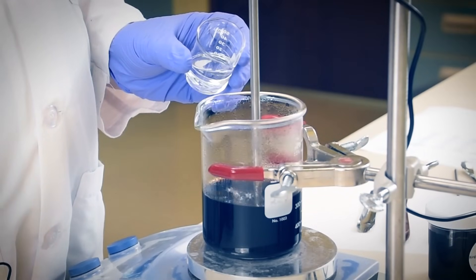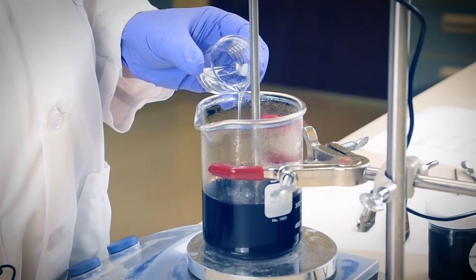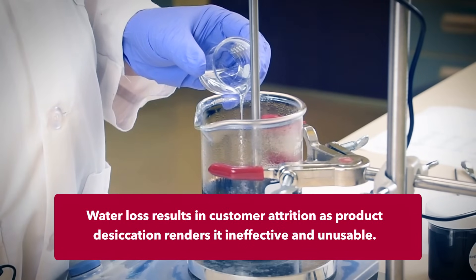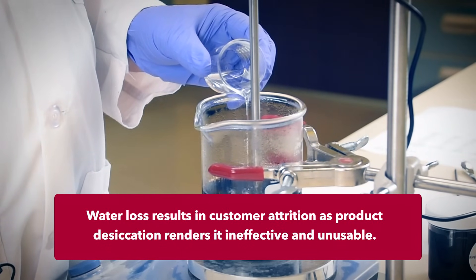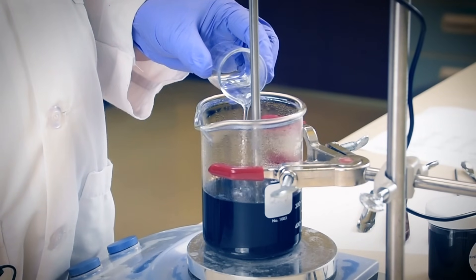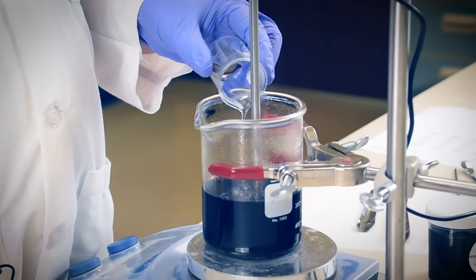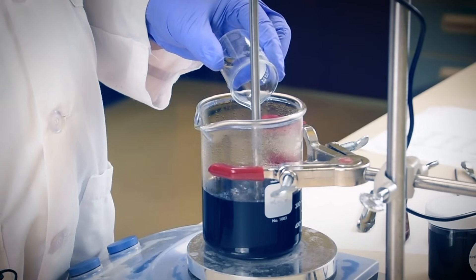We'll then add two polyols in equal amounts: glycerin and butylene glycol. These perform three functions: they inhibit desiccation of the pomade inside the jar, extending the product shelf life; they lower the set point by eutectic association with water; and they add some humectancy to the final product — never a bad idea when treating hair of African origin, for which drying effects are all too common.